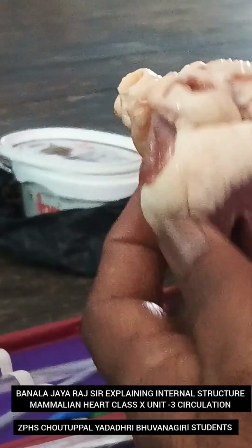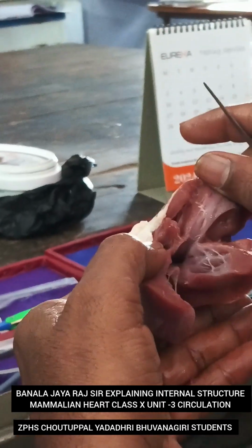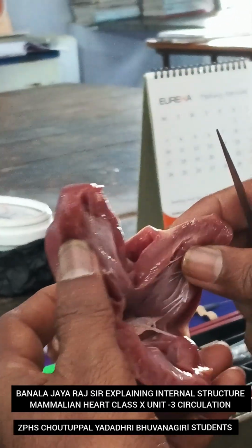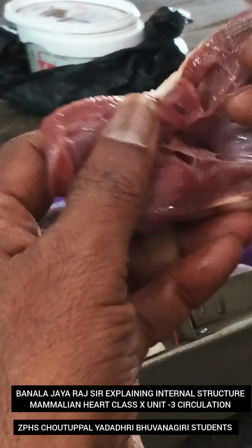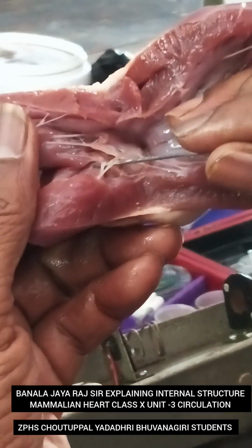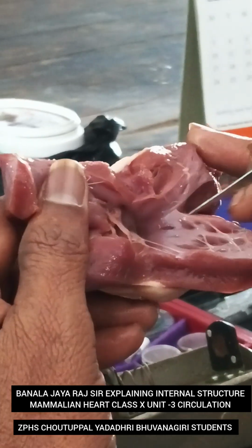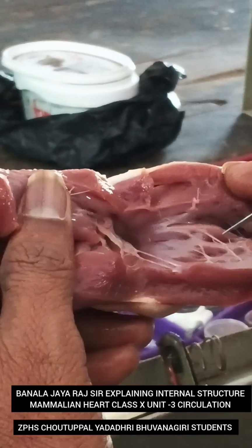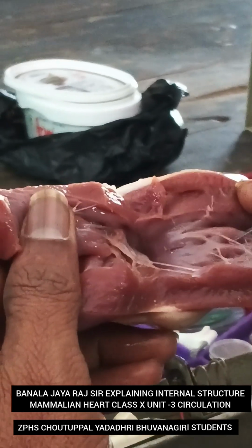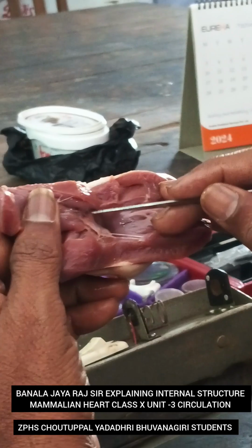So here this heart is already dissected, and here you are observing the presence of what? Valves. So here you see, these are called valves. On the right side you see the presence of what? Tricuspid valve. This is called the tricuspid valve. And on the left side we are observing the presence of the bicuspid valve or mitral valve.